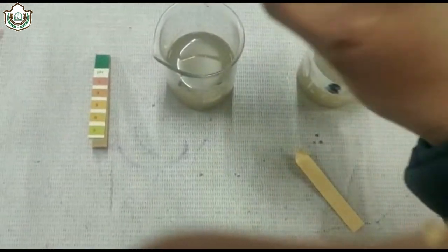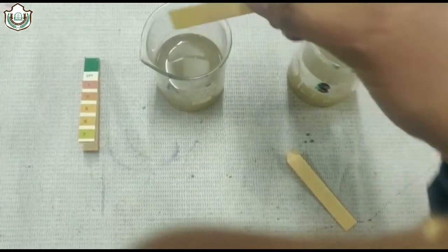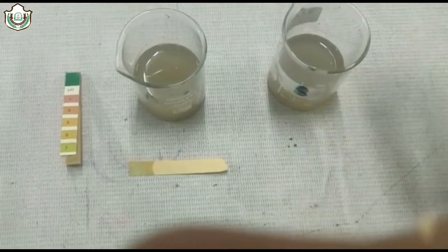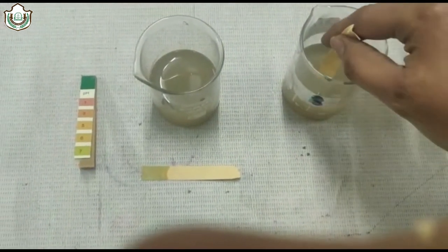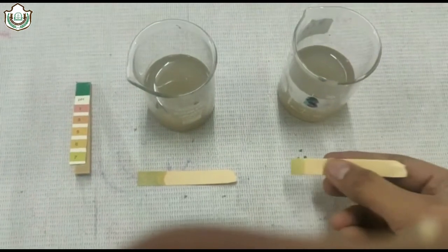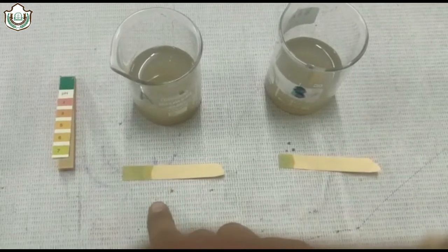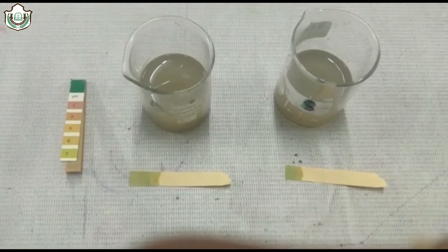We dip one pH paper in soil sample A and note down the reading, and one paper in soil sample B and note down the reading. In soil sample A the pH is 7, and in soil sample B the pH is 8. Thank you.